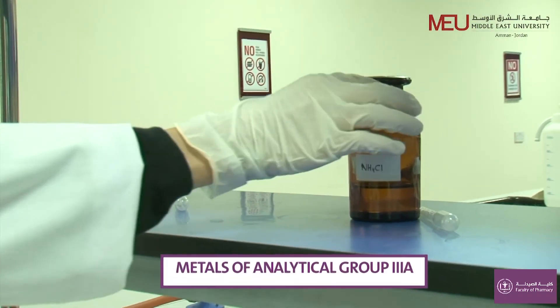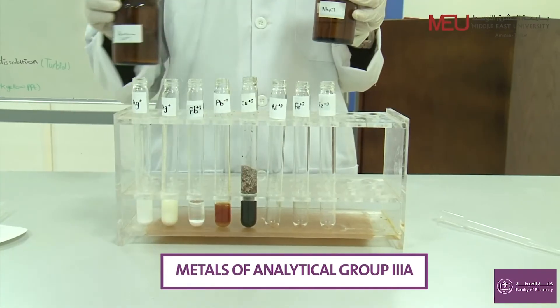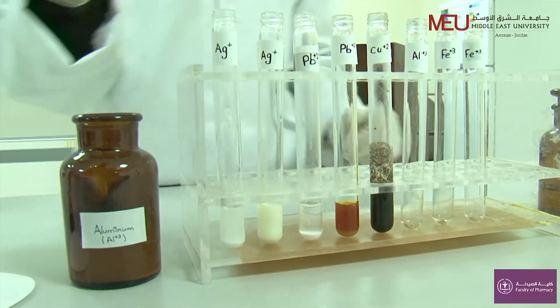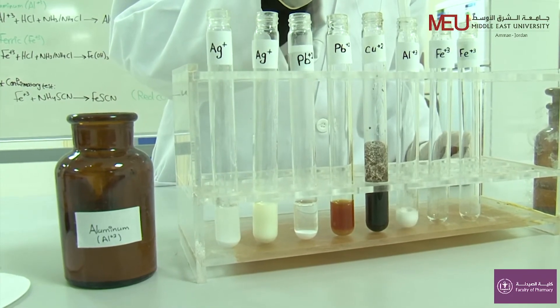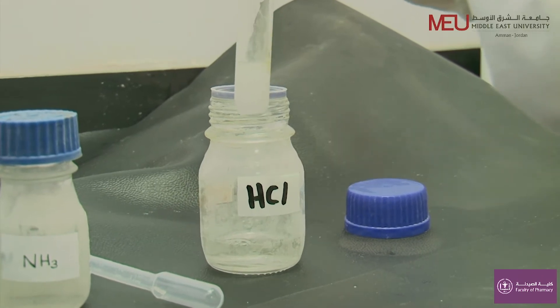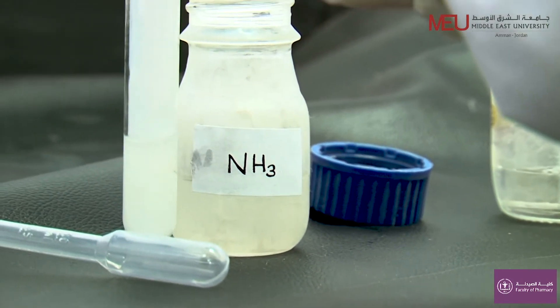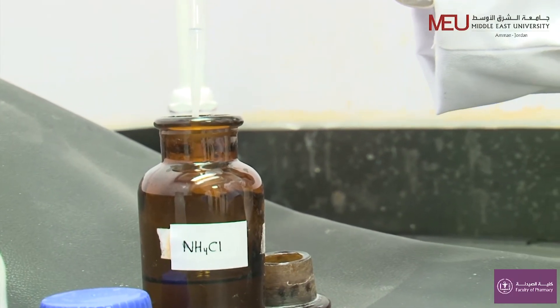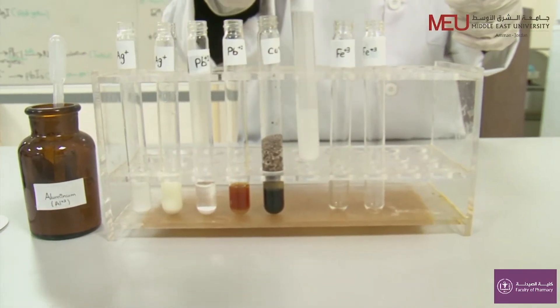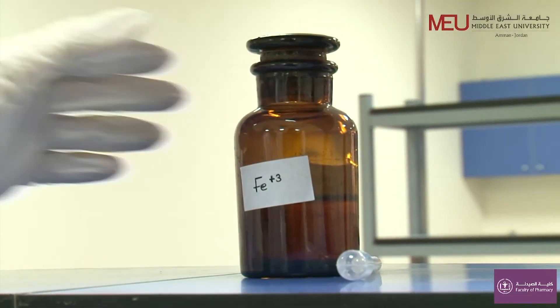The metal ions of this group are separated as hydroxide in basic medium. This group includes aluminum ion and ferric ion. To a solution containing aluminum, add 1 ml of HCl, 1 ml of NH3, and 1 ml of NH4Cl. A white gelatinous precipitate will be formed.